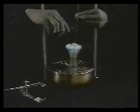If crystals should form in the filter paper, use fresh, hot recrystallization solvent to dissolve the crystals. Later, the filtered solution would probably need to be concentrated.